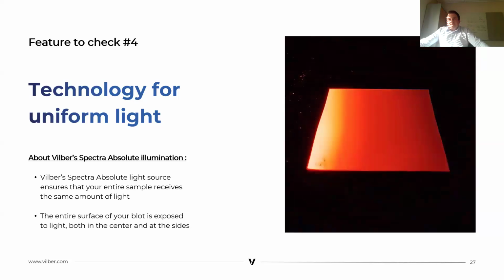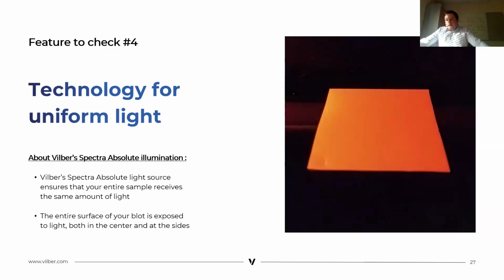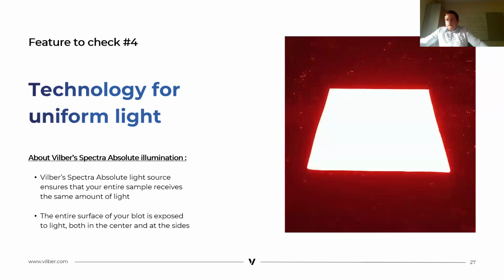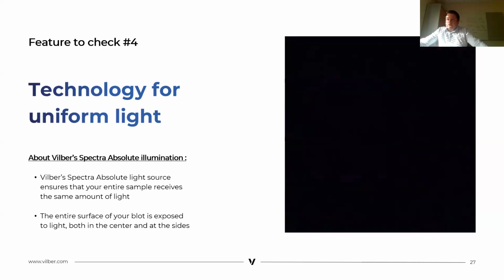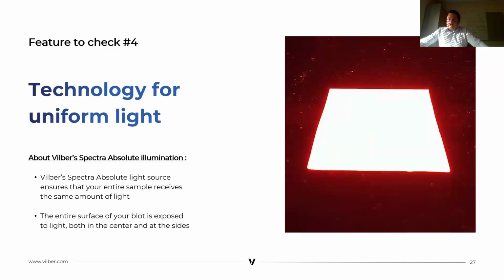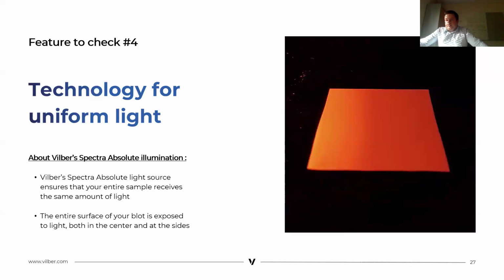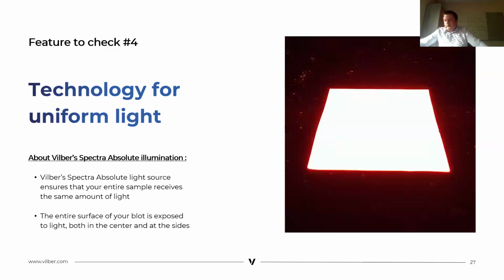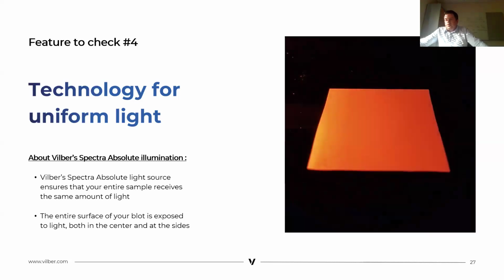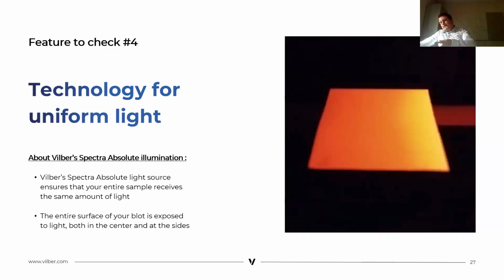To avoid that, and on this slide you can also see, we have developed a new spectral excitation called absolute illumination. The idea is quite simple. The light source ensures that the entire sample receives exactly the same amount of light, and this helps eliminate intensity variations that could otherwise affect the accuracy of the analysis. In practice, the whole blot is evenly illuminated from the center to the edge of your membrane. As a result, you get a truly homogeneous signal, which significantly improves both reliability and reproducibility.